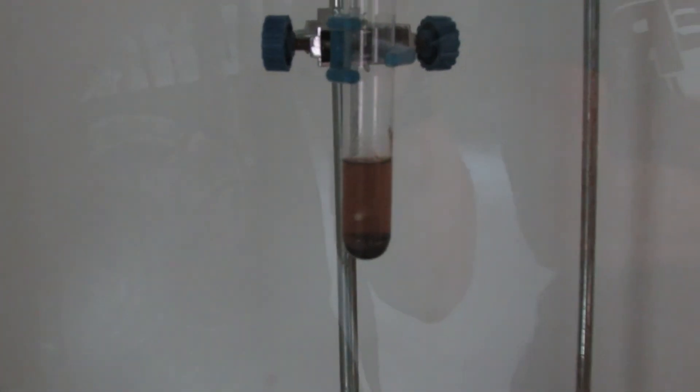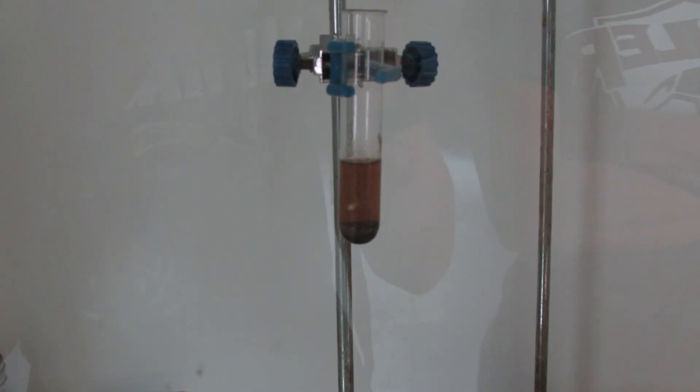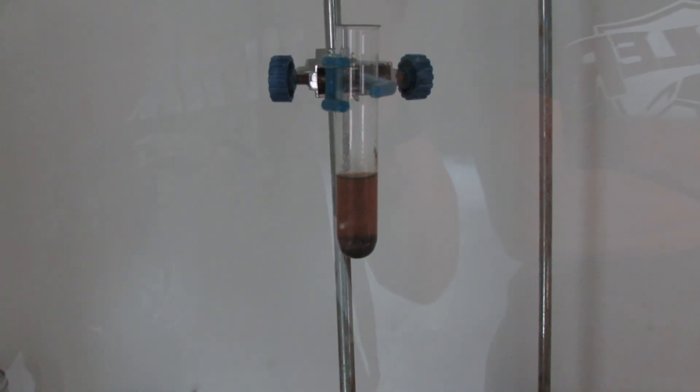And I have the fume hood on. If you don't have a fume hood, it's good to do this outside because it makes manganese fumes.